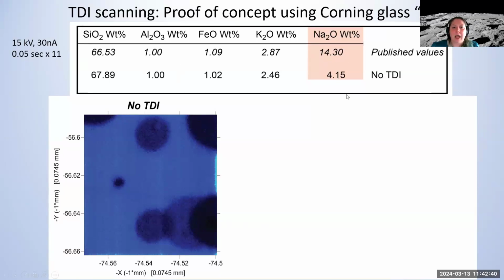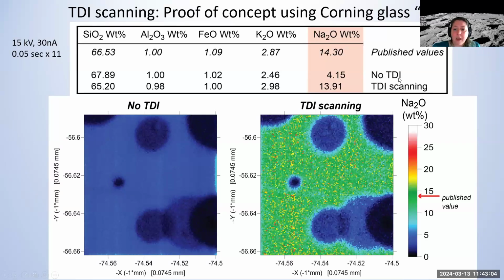Okay, so when I aggregate all these maps without TDI, what I get is exactly what I always worry about: compositions that, instead of 14 weight percent, give me like 4 weight percent for sodium. Usually the silicon goes up, the sodium goes down, and I have like 1.5 weight percent more silicon in the values. Now, when I apply the TDI scanning, I actually get really great data, all things considered. It can be fine-tuned a little bit, but specifically for the sodium, I do get very close to the published value.